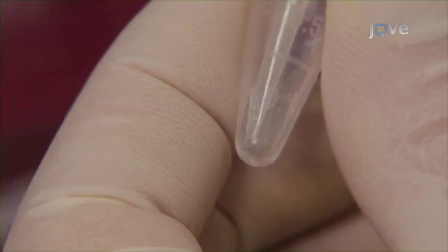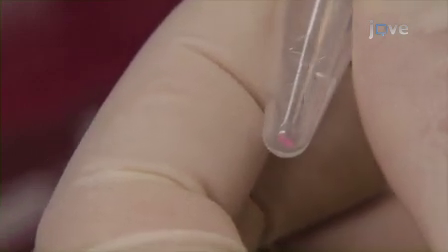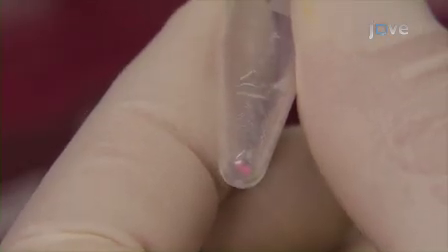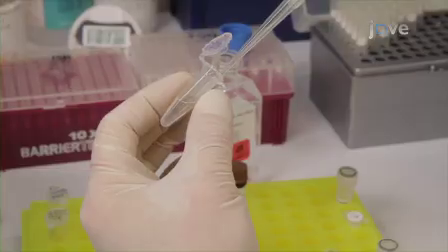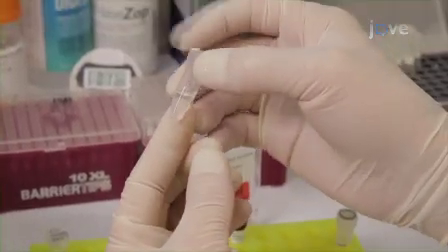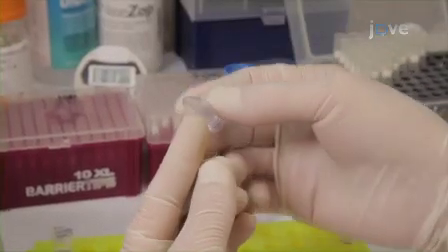To begin the procedure for cleaning the cDNA pellet, use a P1000 micropipette to carefully remove all of the supernatant from the tube. Be careful not to disturb the pellet, it is your sample. Add 500 microliters of cold 80% ethanol to the tube. Gently cap the tube and invert it slowly several times. Watch your pellet very closely to make sure it does not become detached from the side of the tube.